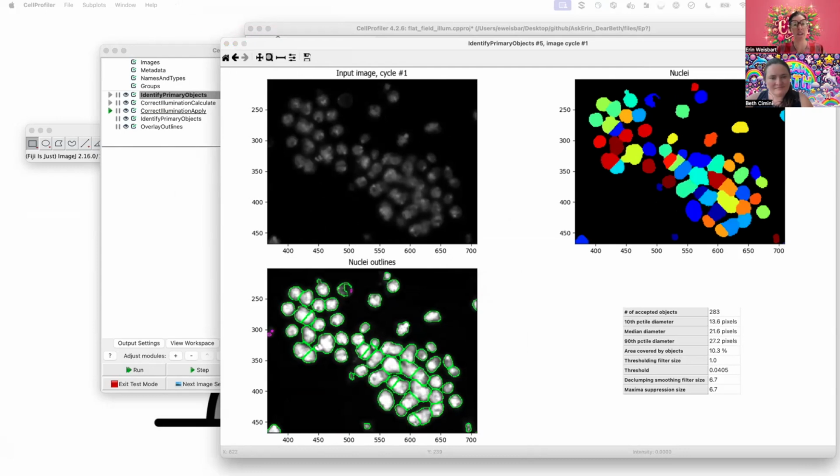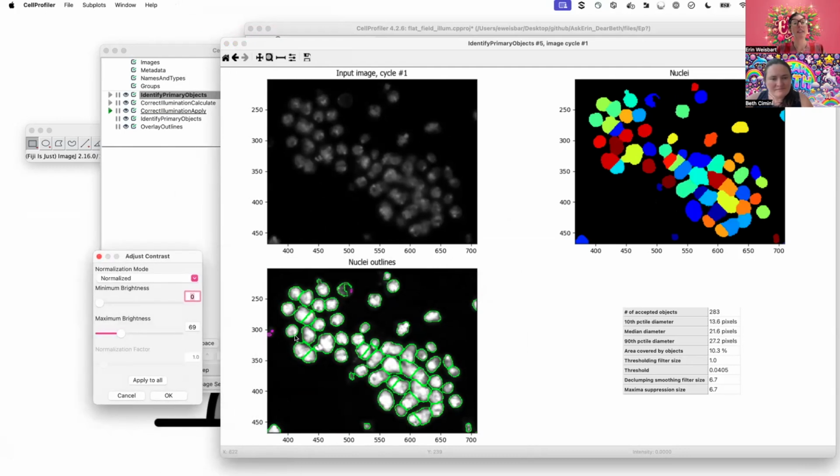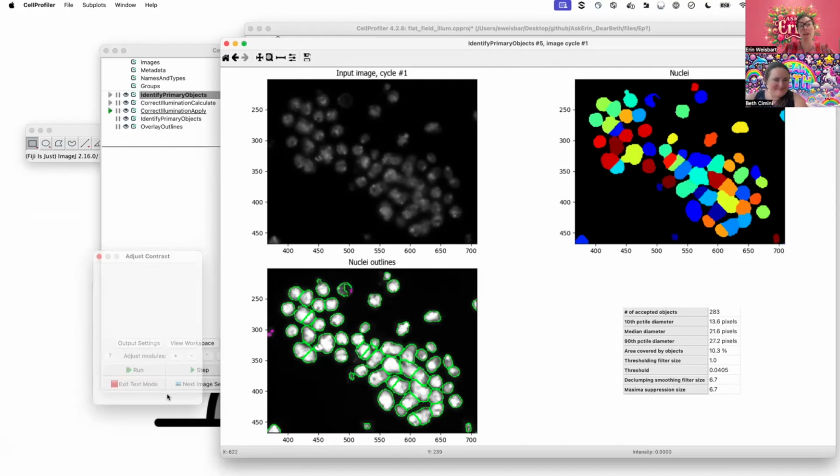And if I see these defaults, well, quite a bit, I see these objects found with the settings that we ship with our example here, maybe aren't actually matching by eye, like where I would draw the lines for these cells. That looks like it's cutting into a cell, and maybe it's getting dimmer there. I'm not really sure why it's perhaps cutting in the middle of a cell here. I don't hate this segmentation, it's not terrible, but it's certainly not perfect. Maybe it could be improved. Here, something a little funny is going on where it's finding, maybe that's a whole cell, should be a round cell there. I don't know. But let's see.